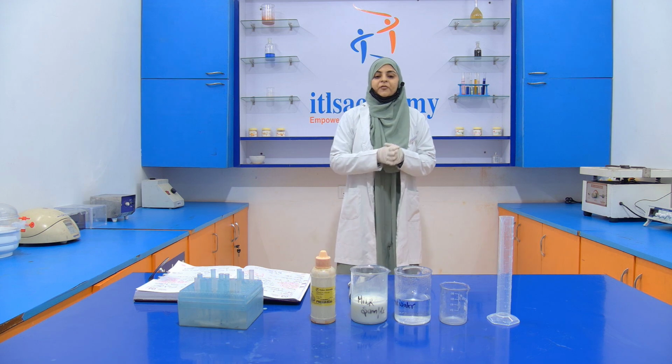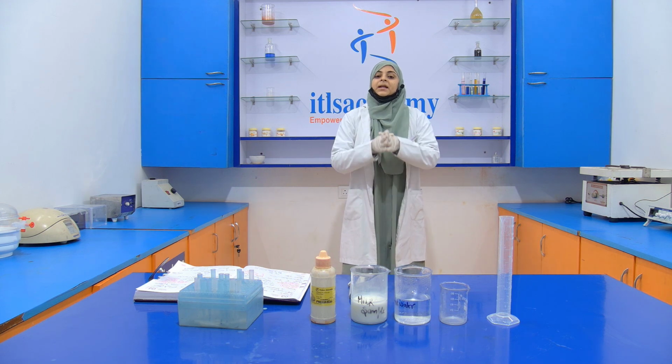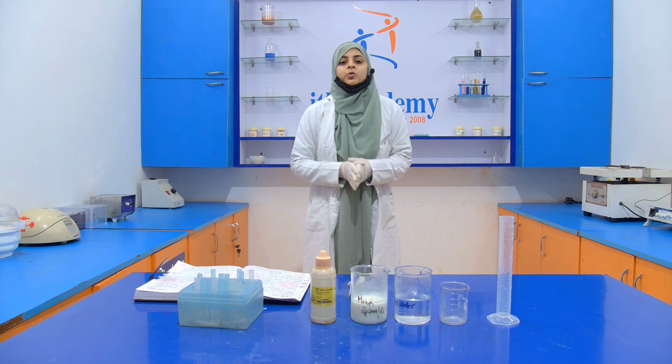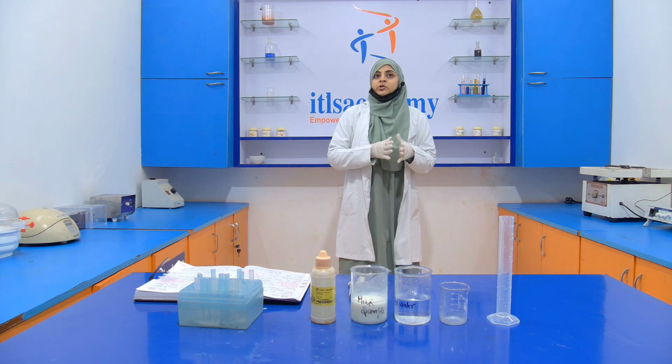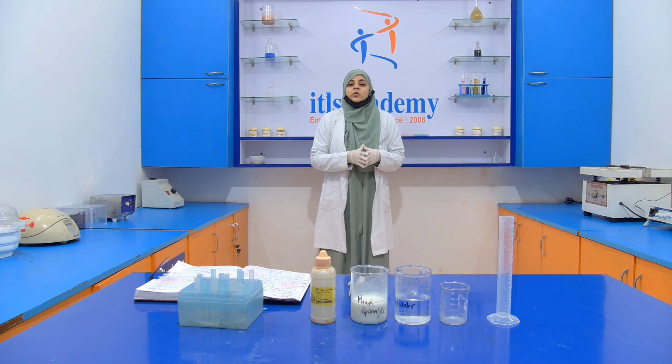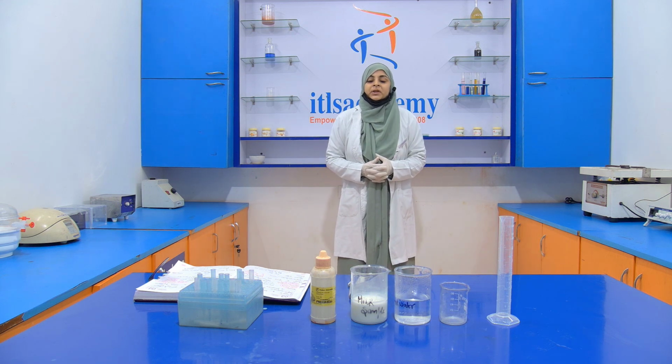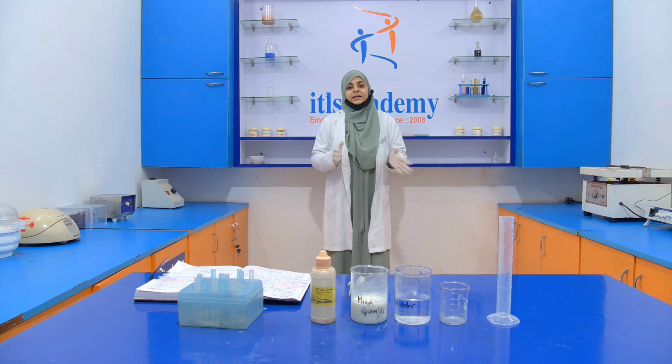Today we are going to perform another experiment, that is the detection of pulverized soap in milk. Okay, so here, what is pulverized soap? It is an adulterant, because when this pulverized soap is added into the milk, the quality of the milk decreases.